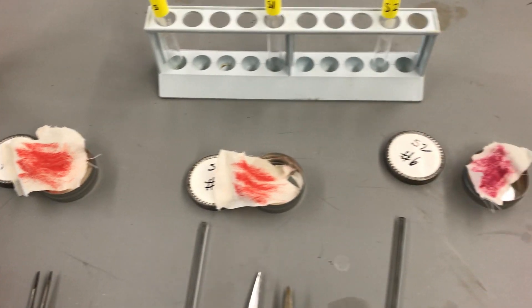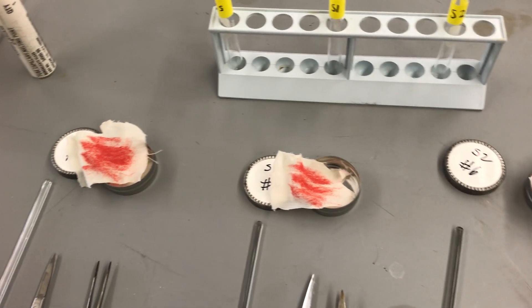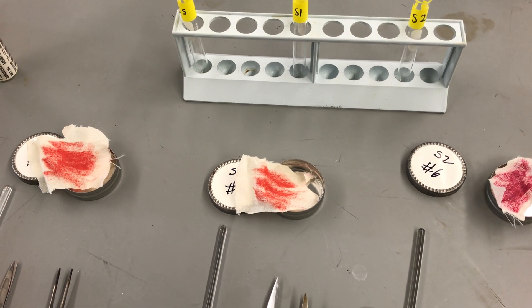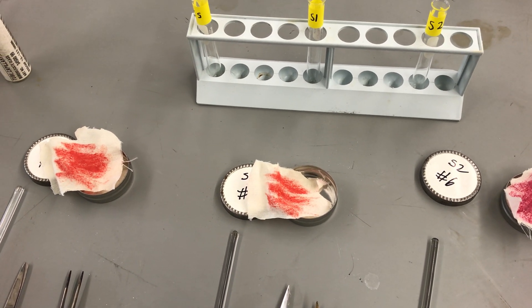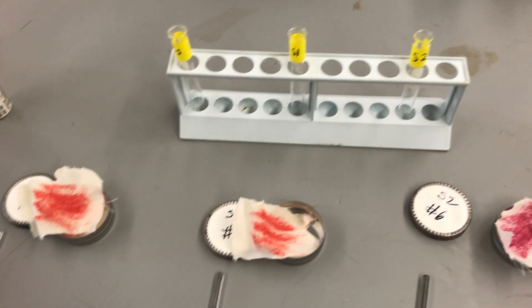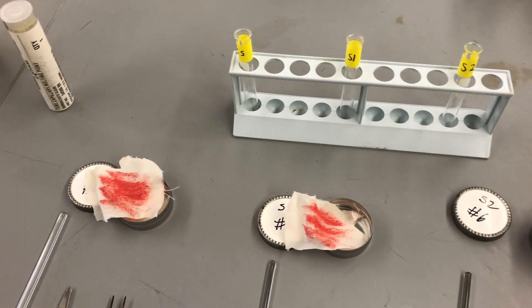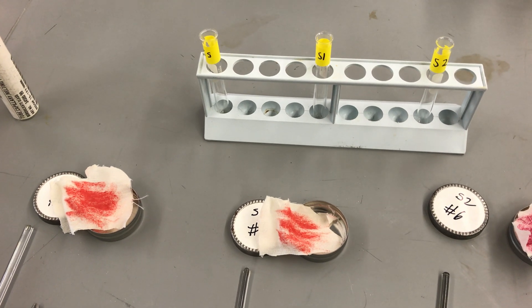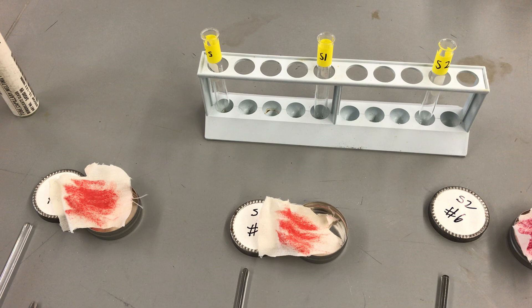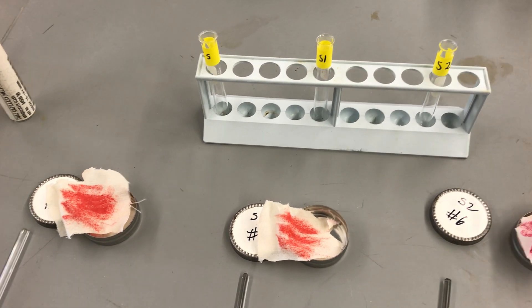After we visually inspect our different colored samples — remember to record the colors on our data table — we're going to take a one centimeter square piece of the stain and place it into our test tubes. We're going to do this very carefully. We'll pause the video for now and pick back up once we have our samples in the test tubes.